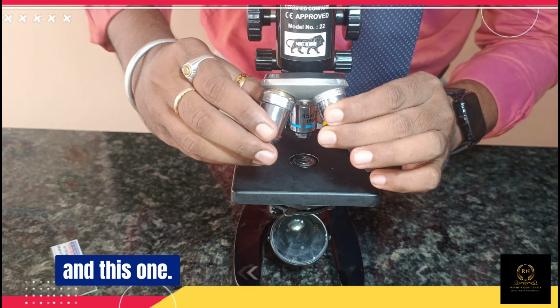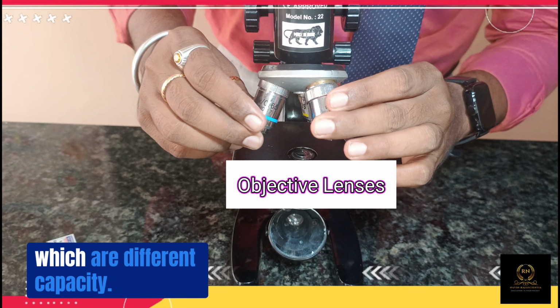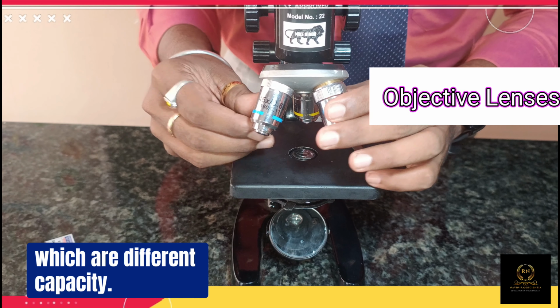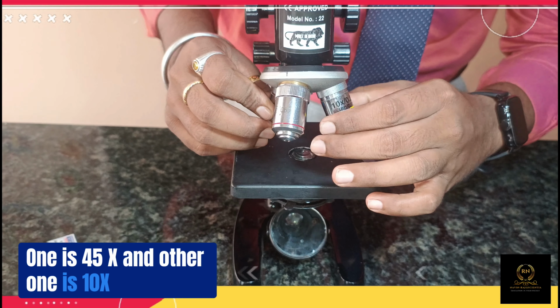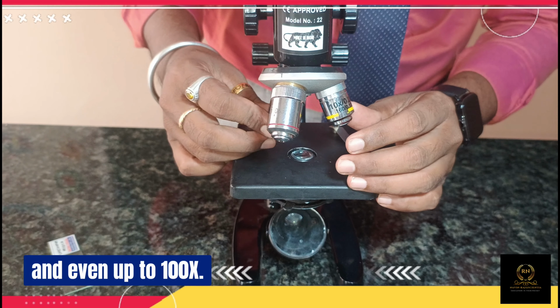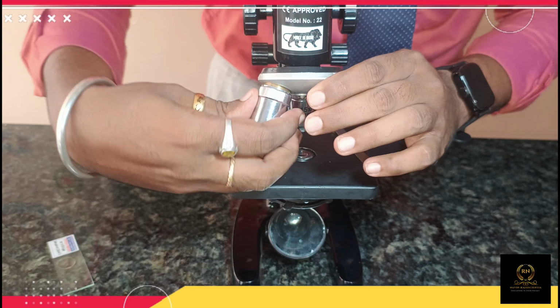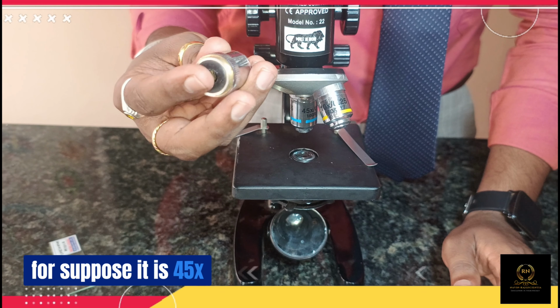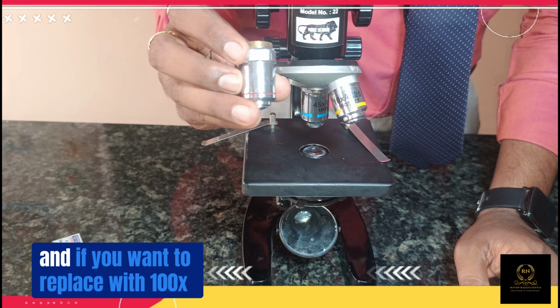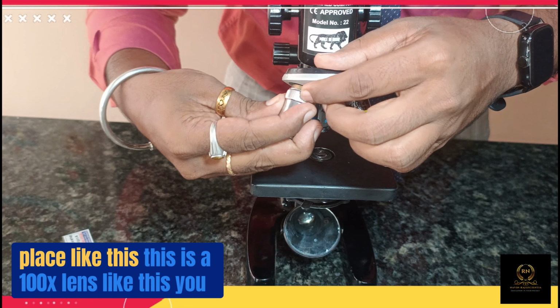And these are the objective lenses, which have different capacities. One is 45x and another is 10x, and you can even zoom up to 100x and see the detail of the specimen. Suppose it is 45x, and if you want to replace it with 100x, you can simply move one lens out and place another like this.